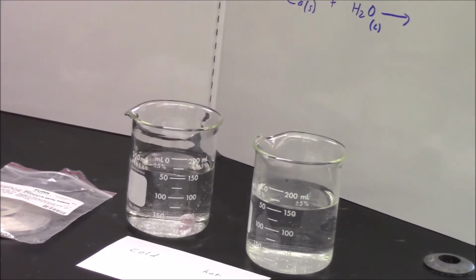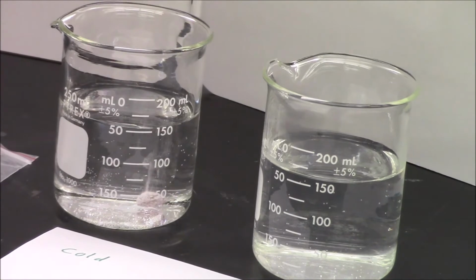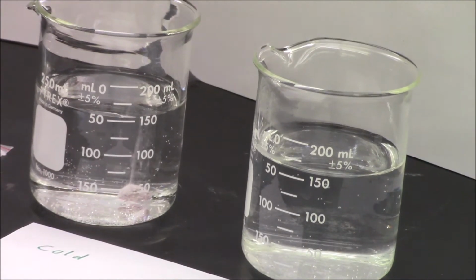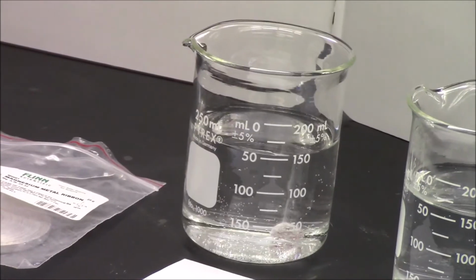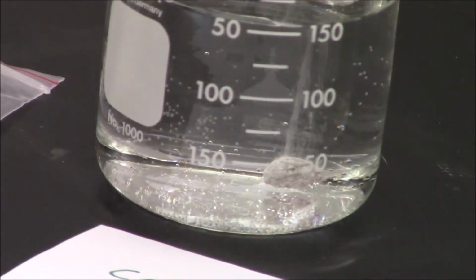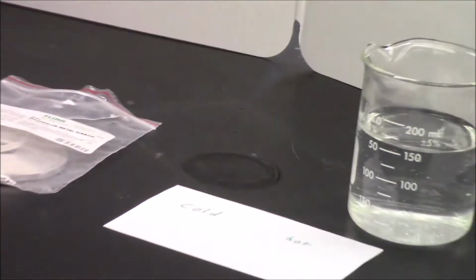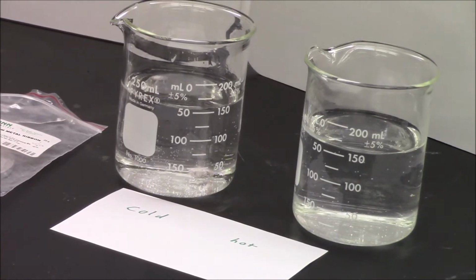So take a little piece of calcium, drop it in, and you'll see a stream of bubbles coming up. And you might also notice a faint pink color beginning to form. We'll give it a little more time. The pink color is actually on top of the metal where the bubbles are forming. Oops. I'm trying to give these guys motion sickness because I can't keep the camera straight. There we go. I think you can see a little bit of that pink color. So we're making some hydroxide ions. This is also a single replacement reaction. The bubbles tell us we're making a gas.